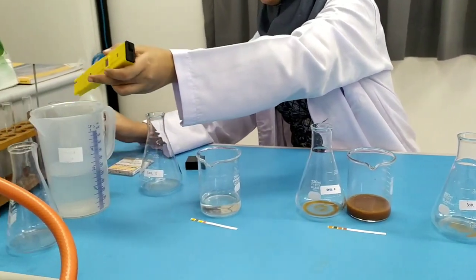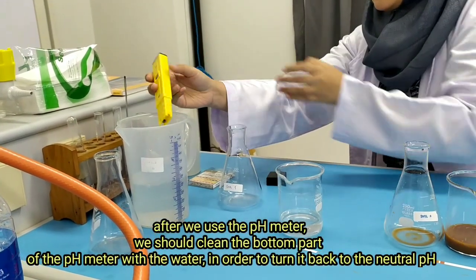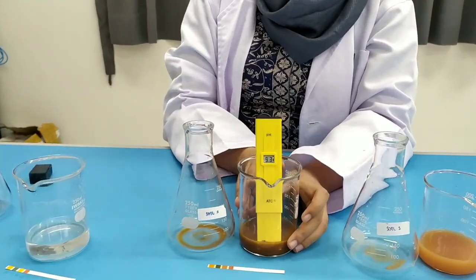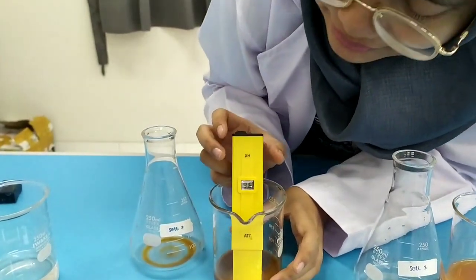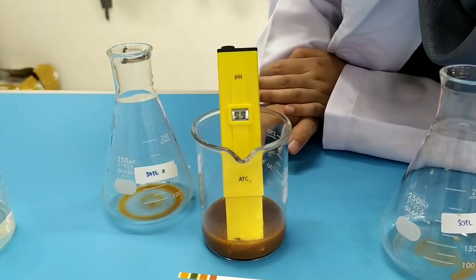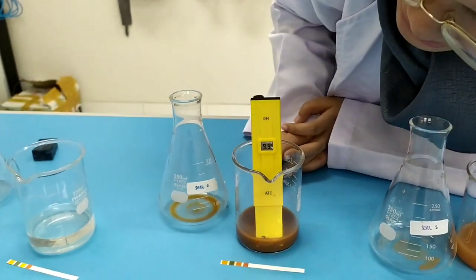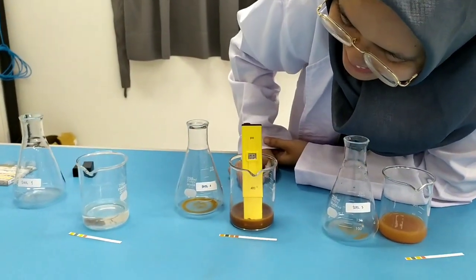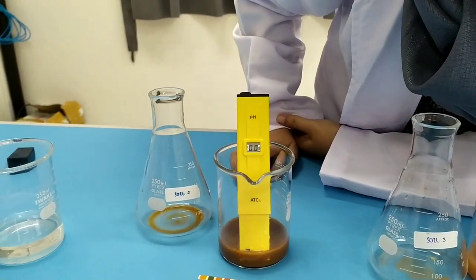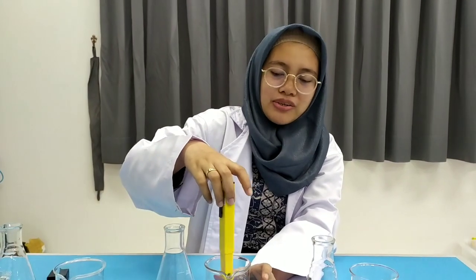We will clean the meter first using distilled water — it's neutral again. Now we dip it into soil two. It's 9.7 ... 9.8 ... 9.9. It keeps increasing. It stopped at 10. So the pH value from the pH meter is 10 for the second soil.